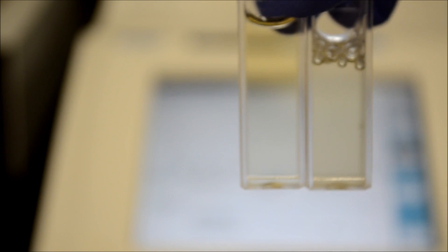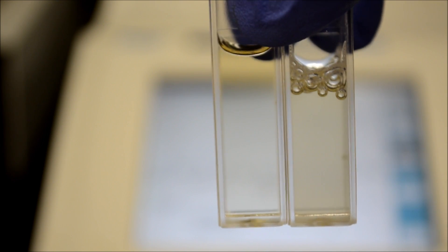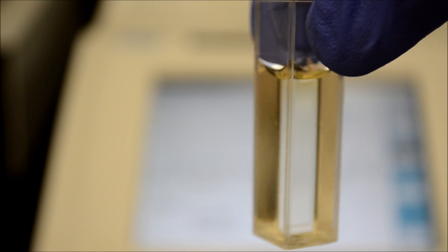Once your bacteria has been growing for one or two hours, you can check if it's ready. Take out two samples. You can see the sample on the right in the cuvette has bacteria, and the one on the left is what we call the blank, which has no bacteria and just consists of LB medium.